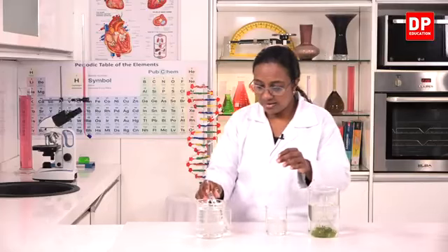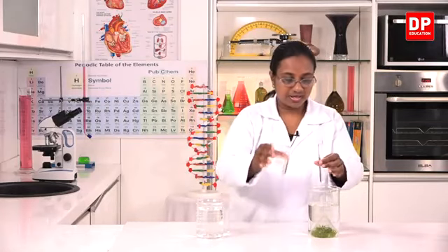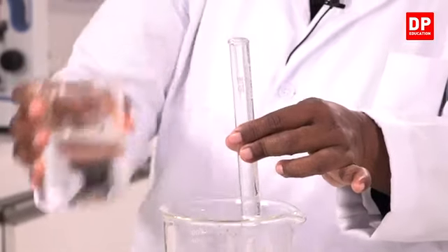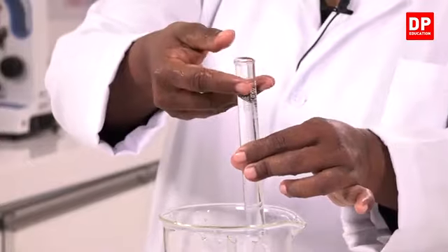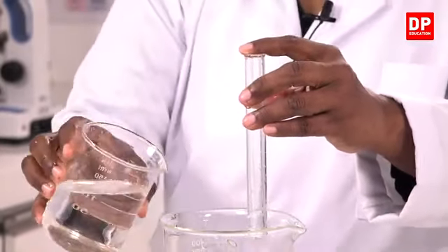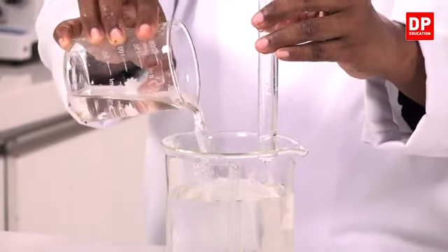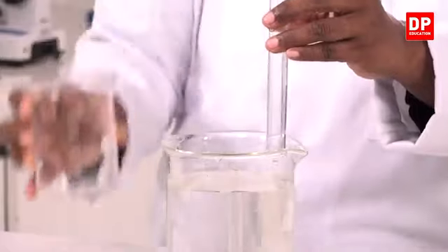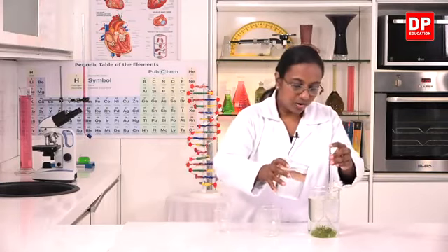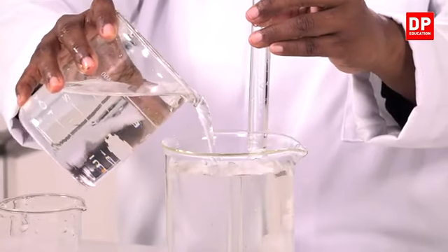So, then I will need this test tube. There is little space. So, what I will do is I will add some more water, fill it up to the mouth. Before doing that, I have to increase the amount of water inside this so that there is no air or any form of gas inside the test tube.